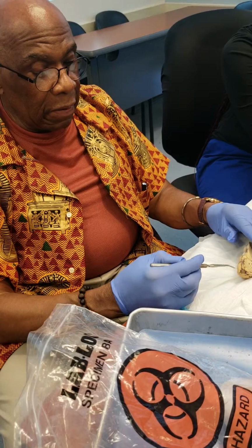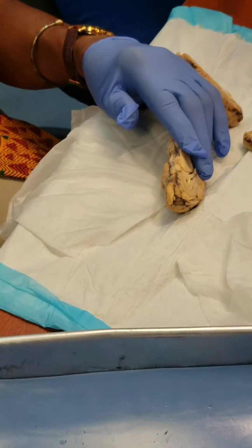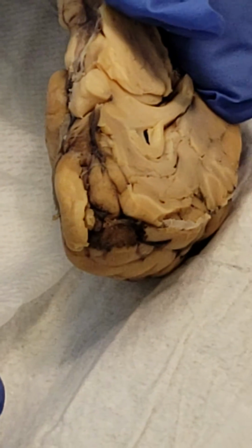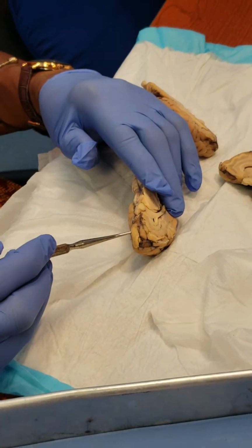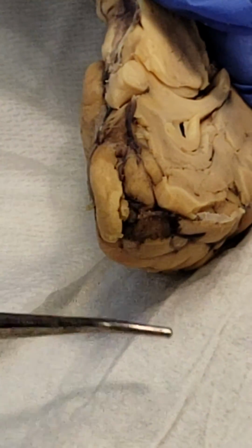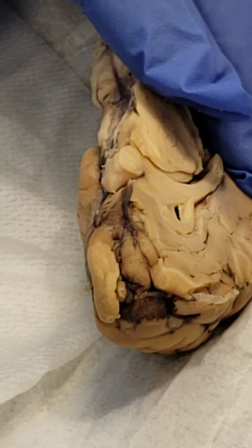Okay? Now, this is the olfactory lobe. Now this sits right there on top of the ethmoid bone. Why? Because the extensions from the ethmoid bone go into the nasal cavity. Smell, right? Now, your ability to smell depends on the neurons that affect this nerve. Are these receptors mechanical, chemical, or photon receptors? It will be chemical. Ding. You get a ding. That's a good answer.